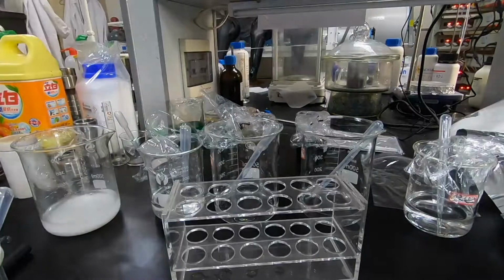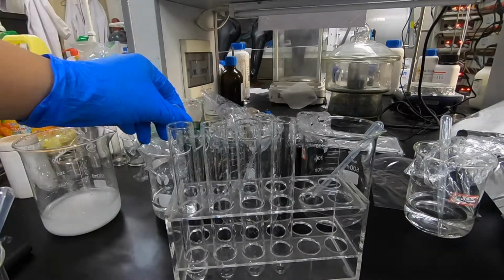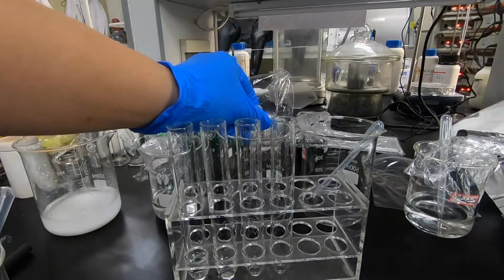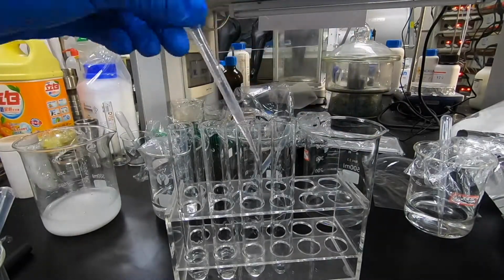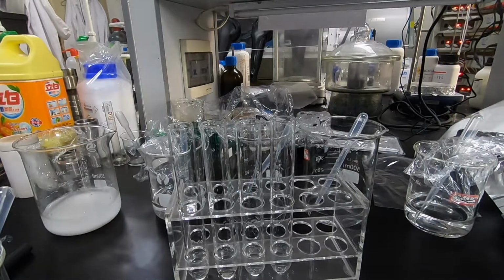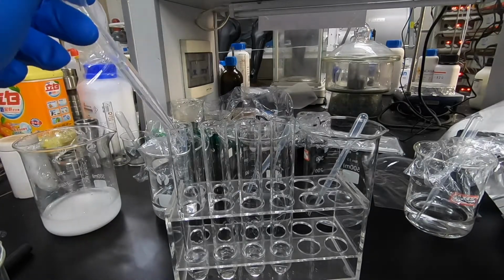We are again emptying and cleaning all of the test tubes, and we are adding solutions 1 to 4 into test tubes 1 to 4, and we are using solution number 5 as a reactant to all of the solutions in the test tubes. Solution number 5 produced a white precipitate with solution number 1.